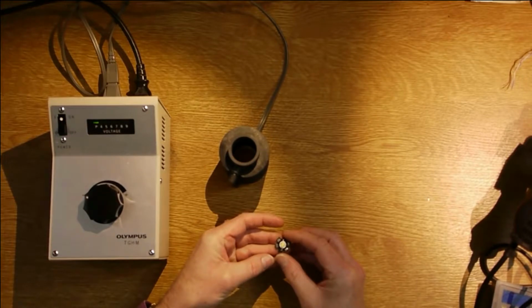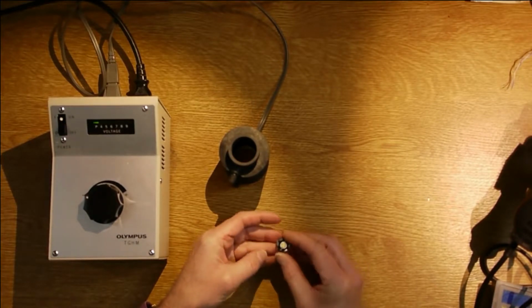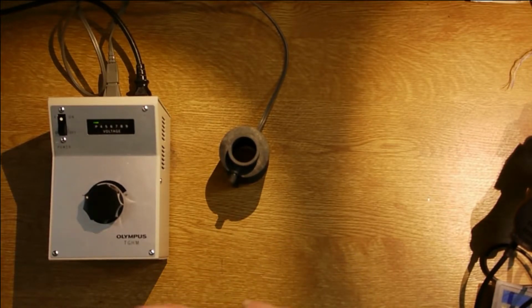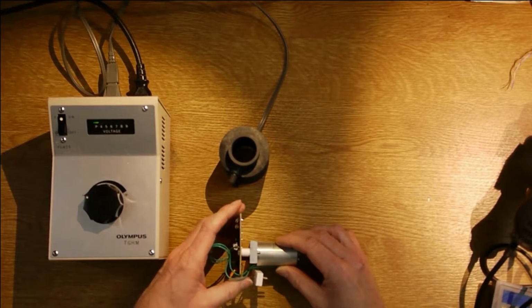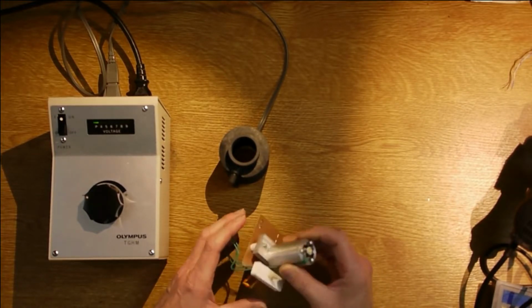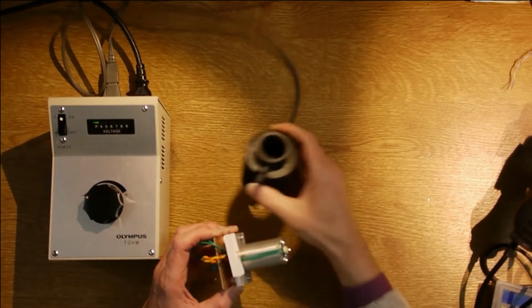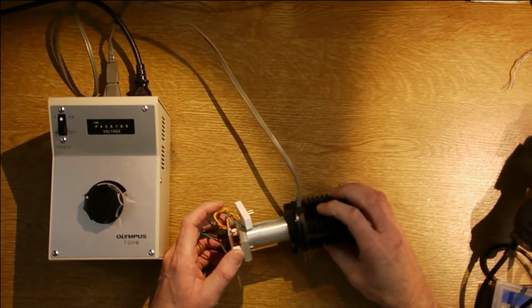This is a 1 watt LED. I bought some 3 watts as well, but this is bright enough for me at the moment, and it's pretty easy to change. And I built this. So this is a block of aluminium with the LED mounted on the end with 3 screws. There's a channel here for the wires to come down out of this assembly, and that just slides into that assembly there.